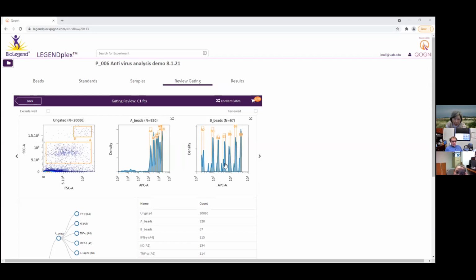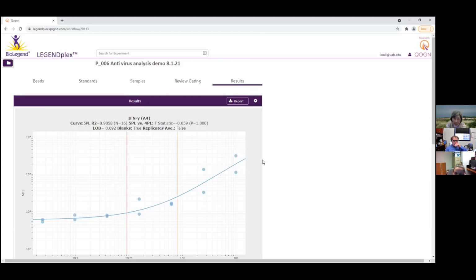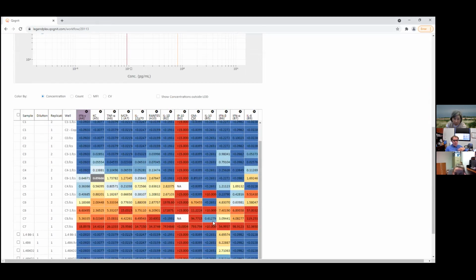I analyzed this with Anthony yesterday, and it did not look like this. Okay, I understand. The point is that when you first did this, we used this crummy software, and they didn't even allow us to do this. I don't even think I saw this. We said, well, there are peaks down somewhere in here. It just gave a bunch of numbers that were inaccurate. So we said, well, what does it really look like? That's why we resorted to drawing it manually.